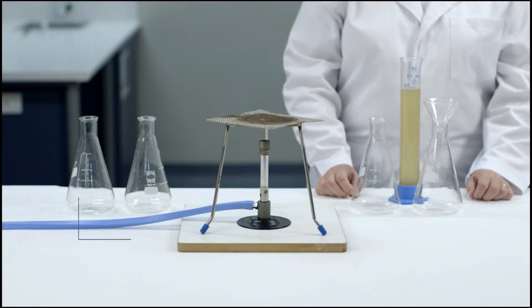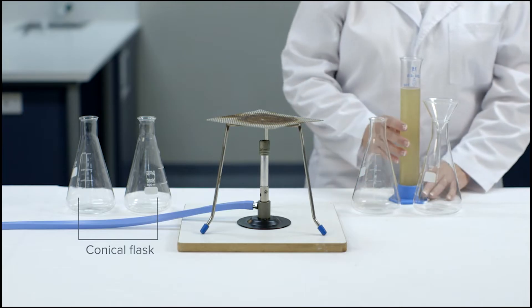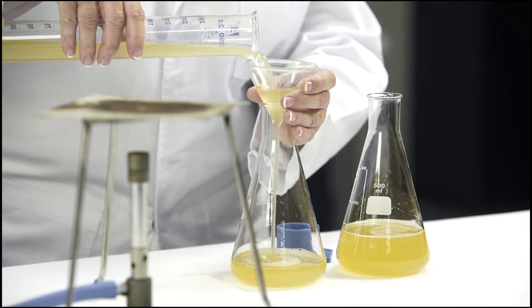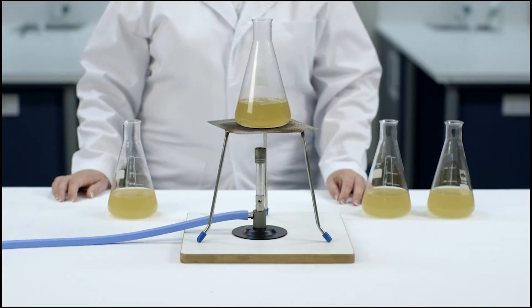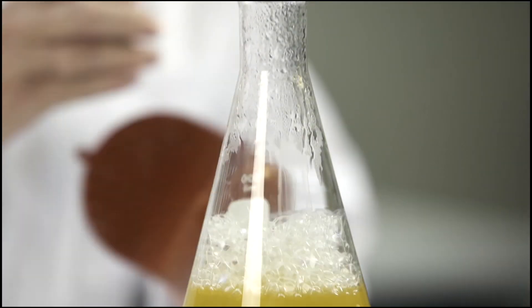The aim of this investigation is to model Pasteur's experiment. Before starting, complete a risk assessment of the investigation. Chicken stock will be used as the nutrient broth and conical flasks will be used as the vessels. Pour 250 ml of chicken stock into each of the flasks. Each of the flasks will be boiled for 15 minutes to destroy any microbes that may be present in the stock.